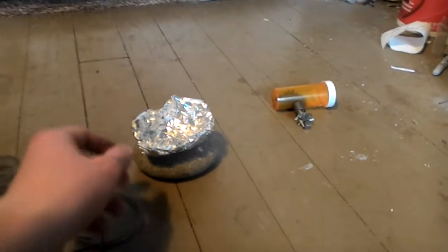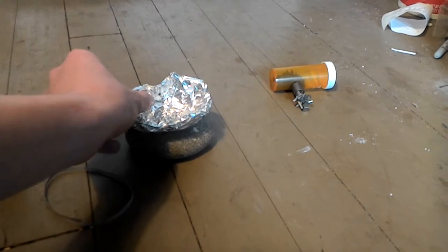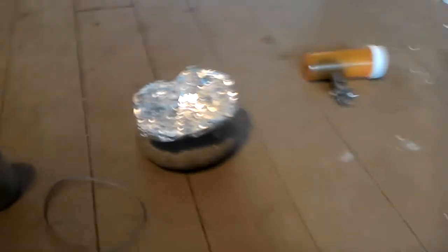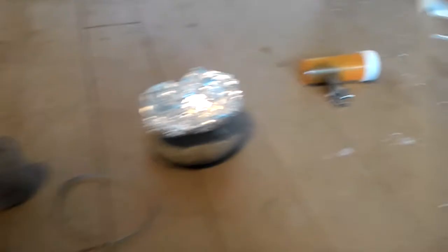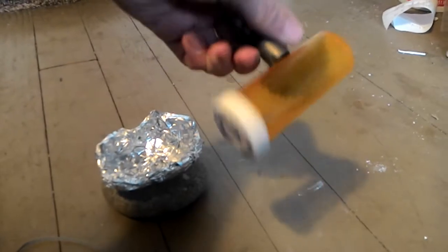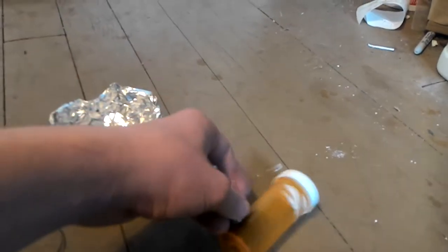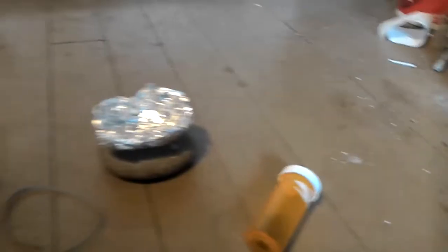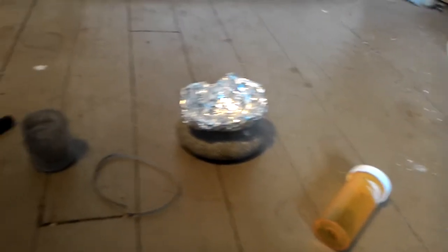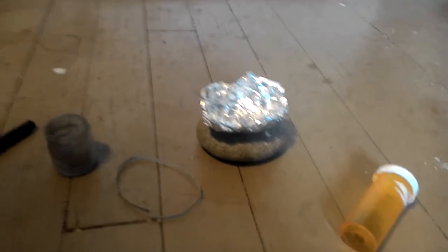It's very fine. I also have this aluminum thing that I made that's kind of like a crucible, sitting on a rock. You can tell that this is magnetite because I have my magnet on it — it's in a pill bottle. Here, pill bottles are actually really common to store things in. I need my stand.